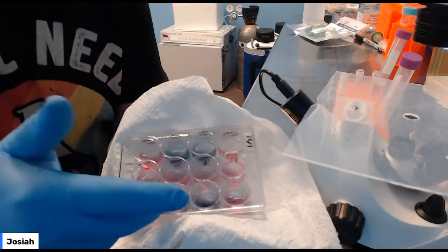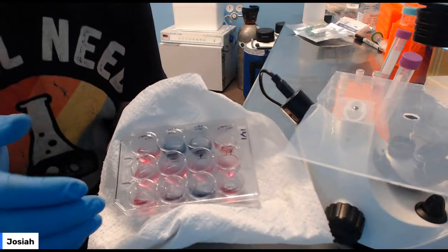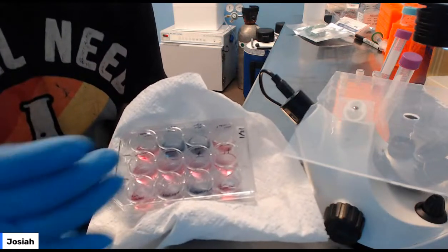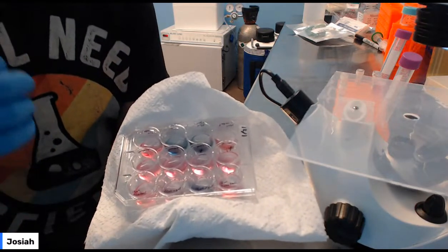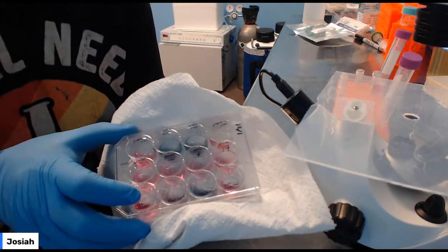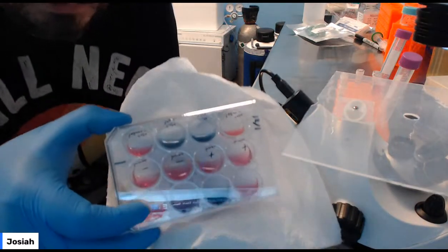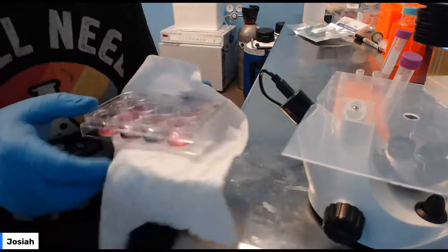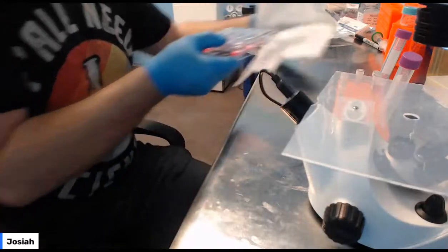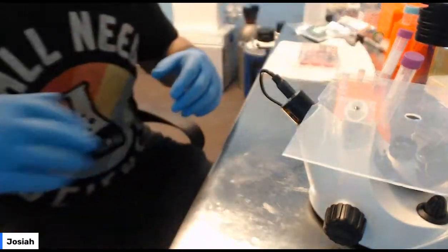Same thing with these. I added 10 microliters to this, so it's kind of a purpley thing. But the purple can happen, it's just the pink plus the blue, if you use a little bit of X-Gal, or you don't get a really efficient transformation, or if you don't have a whole lot of cells. And so it's really brightly blue. It's hard to get an angle on this. I've got some pictures we'll be putting in the classroom, but it should be dramatic.